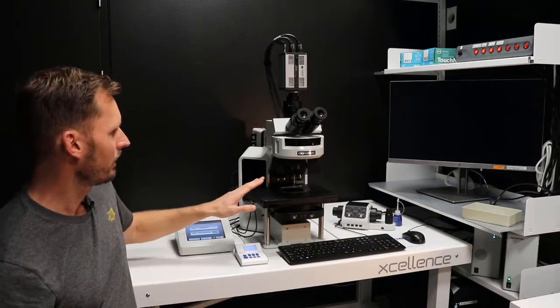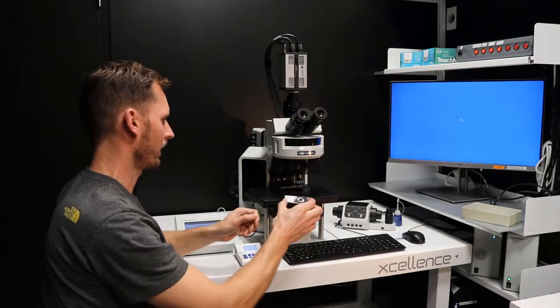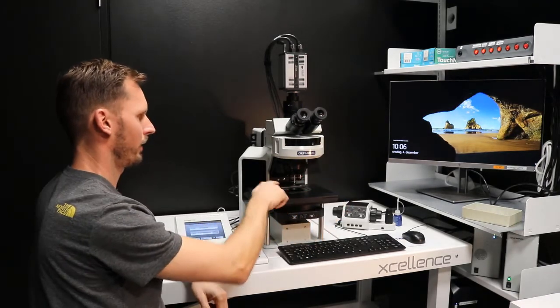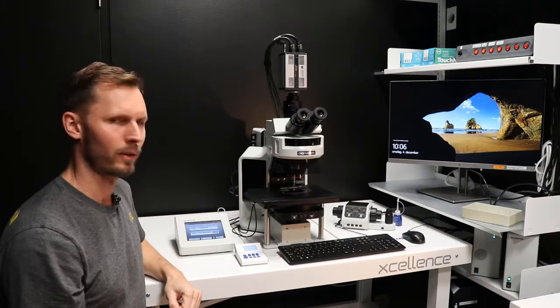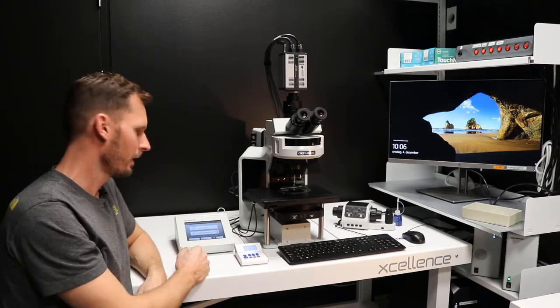And you can see here the stage where you insert your samples. So right now I just put in a sample, slide it in, and with my right thumb push it all the way in. And you can fit one more if you need to. Then you can move the microscope manually, and you can operate it by the touchpad.